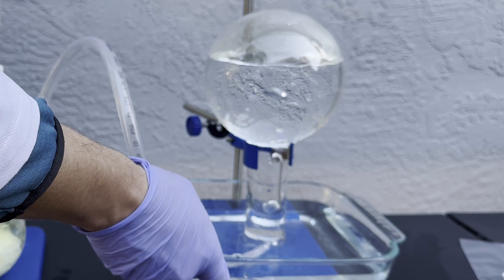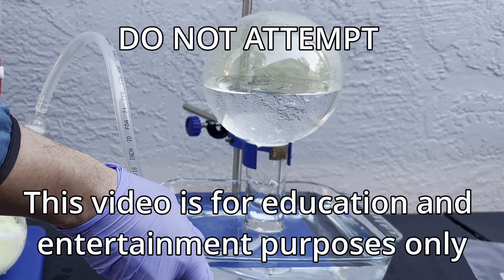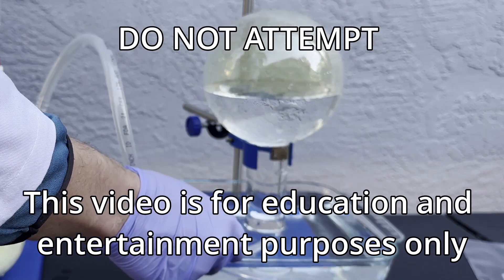Elemental chlorine is a pale yellow and deadly gas that's about three times heavier than air. This should go without saying, but absolutely do not try any of this at home.